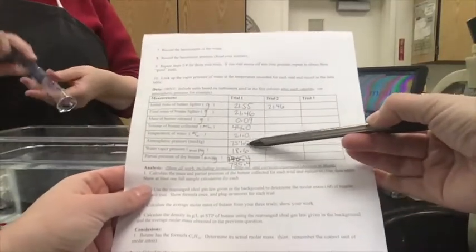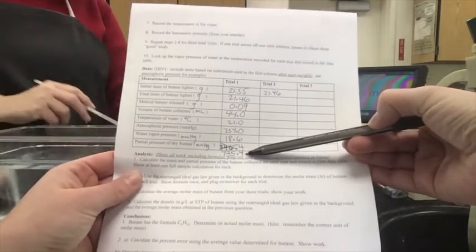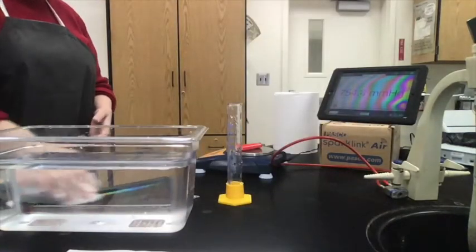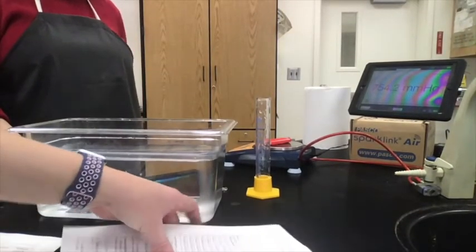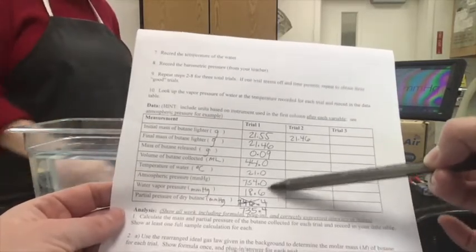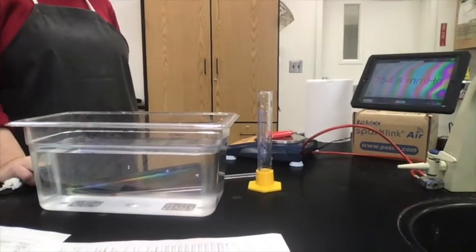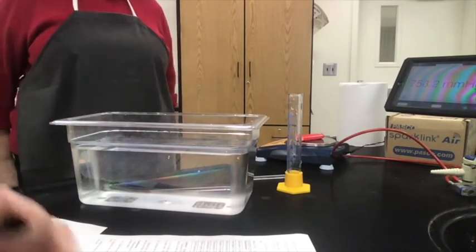Back to the math quickly — on trial 1, the correct math is 754.0 minus 18.6, which gives 735.4. So please cross off the original and write in 735.4. You should be able to fill in the data table for trials 2 and 3 on your own, remembering that the mass of butane is the difference between the initial and final masses, and the partial pressure of butane is the difference between the atmospheric pressure and water vapor pressure according to Dalton's law. Get your analysis questions going and we'll talk about this in class. Bye!